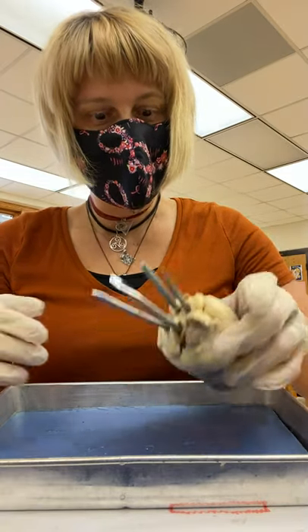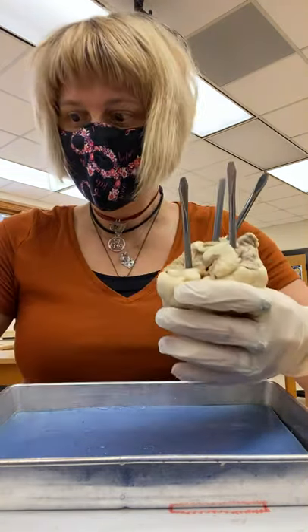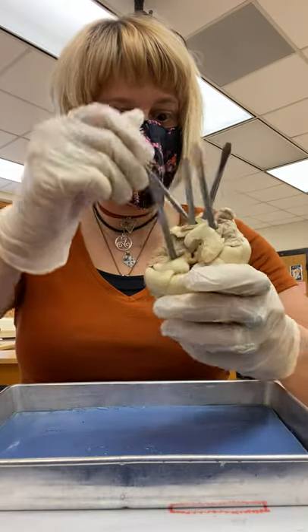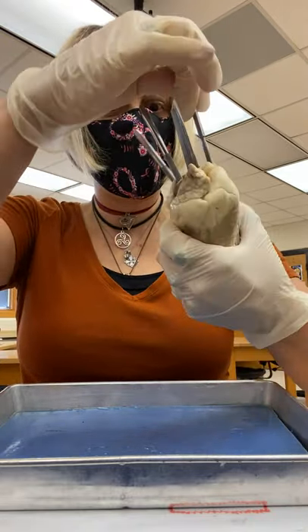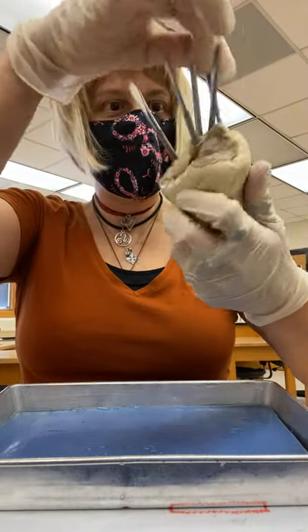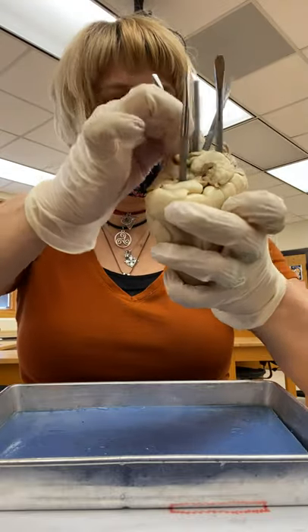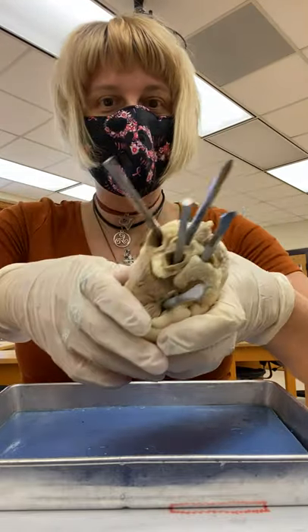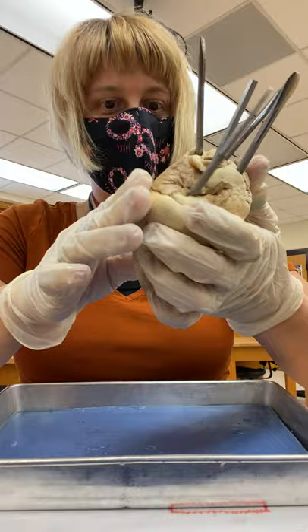The first thing I did before we even went on is to point out all the blood vessels — the great vessels. I've got holes poked through every single great vessel.